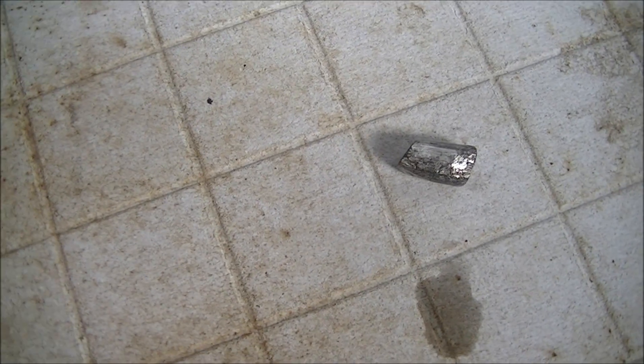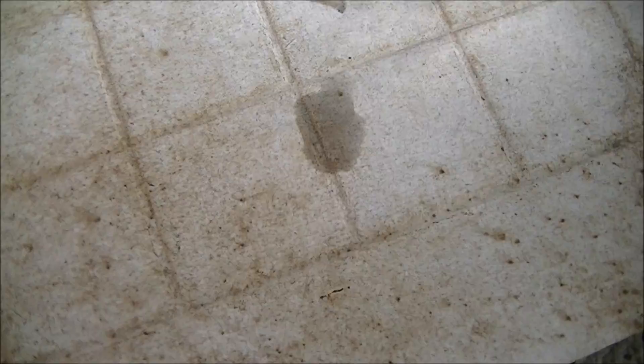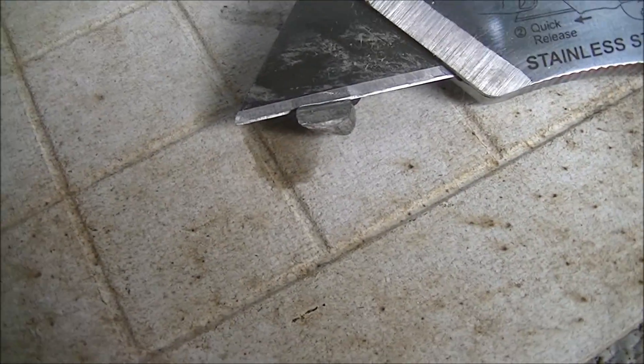So you can see these metals oxidize very rapidly. You can for now see the metallic luster. That won't last for very long.